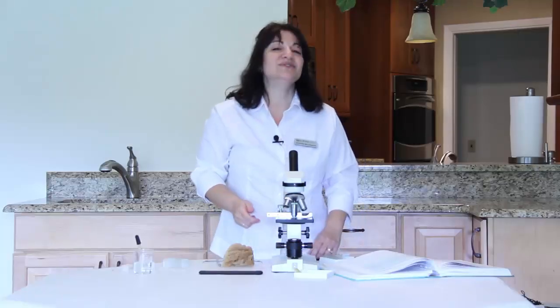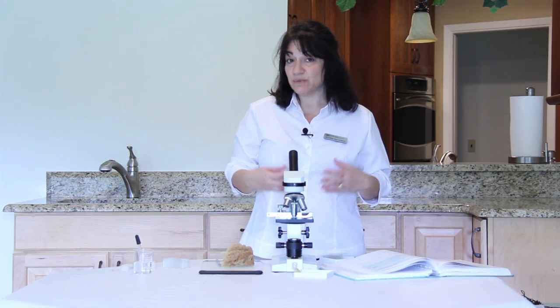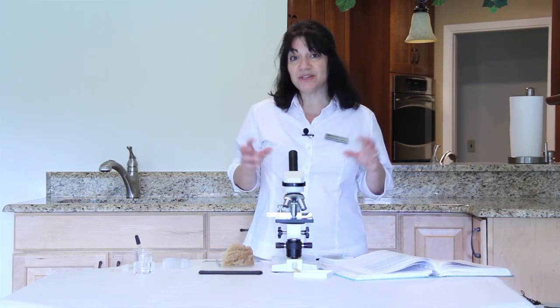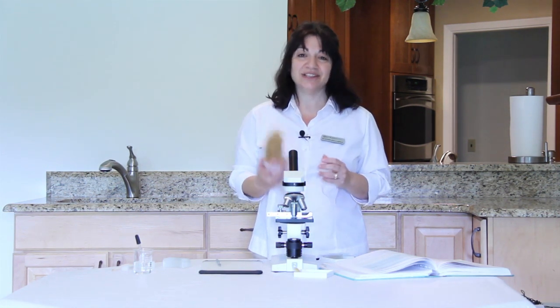All right, and so once you've done that, hopefully you can see that these organisms are very complex. They have specialized cells that are used for multiple purposes in their bodies. And just by viewing the skeleton of a sponge, we're able to get some great understanding of what these guys are made of.